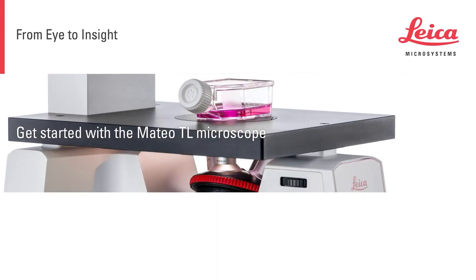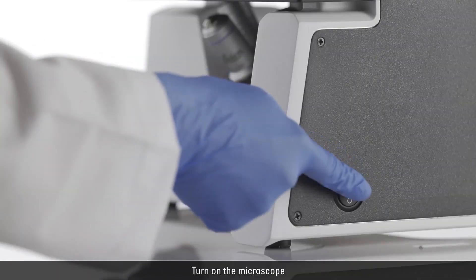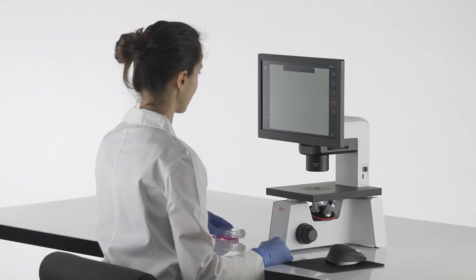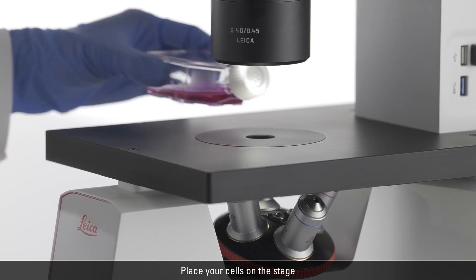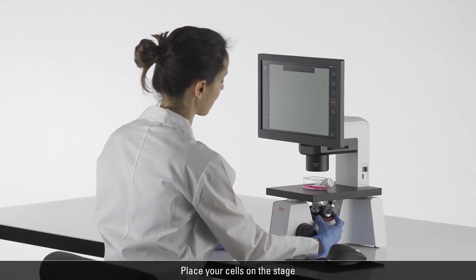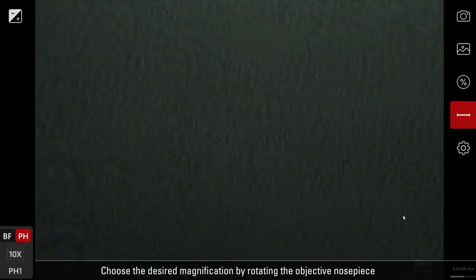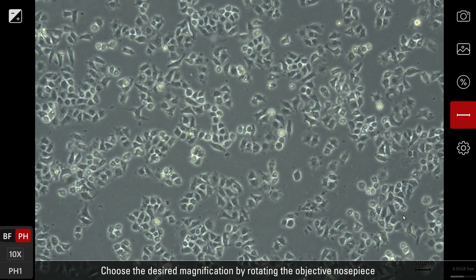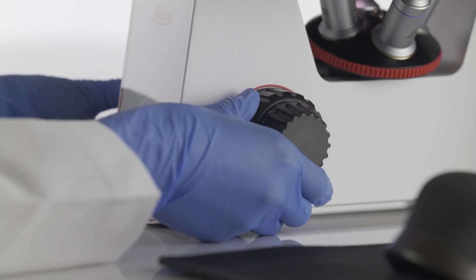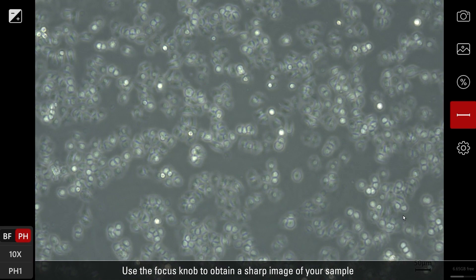Get started with the Mateo TL Microscope. Turn on the microscope and place your cells on the stage. Choose the desired magnification by rotating the objective nose piece. Use the focus knob to obtain a sharp image of your sample.